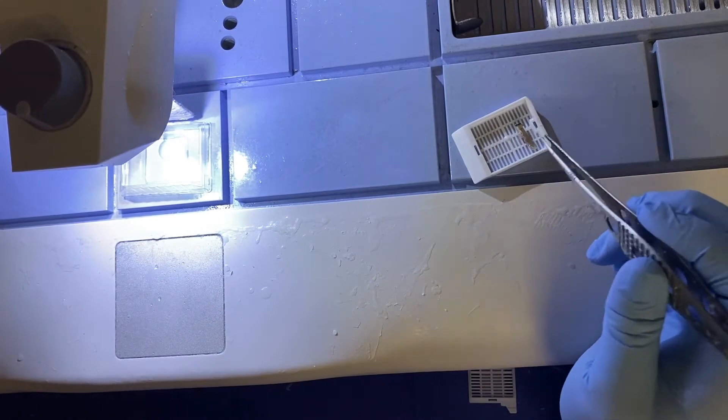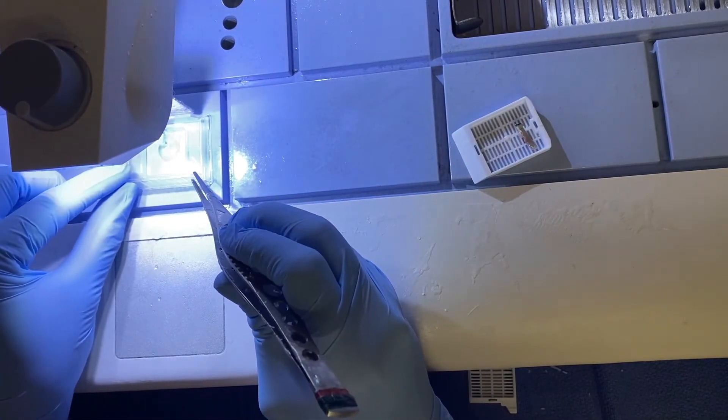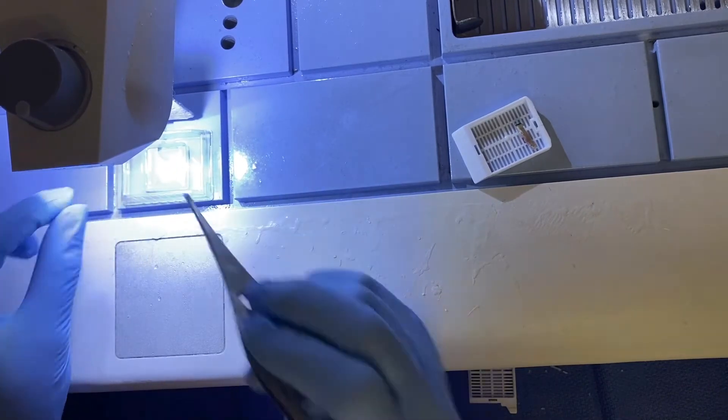And then here we're going to show you how to embed on-edge. So again, just like we did before, put a small amount of paraffin in the bottom of our mold.